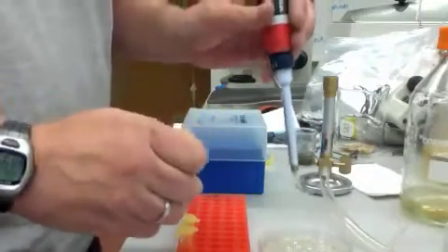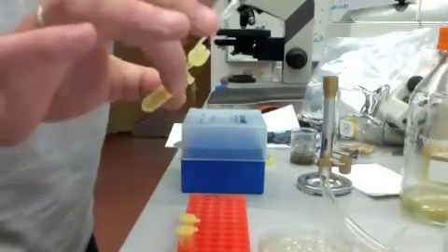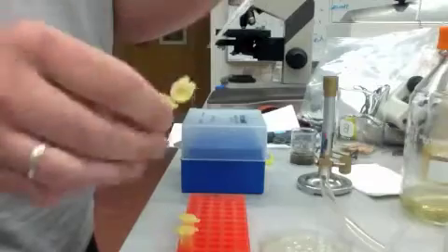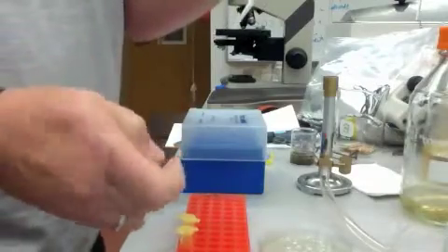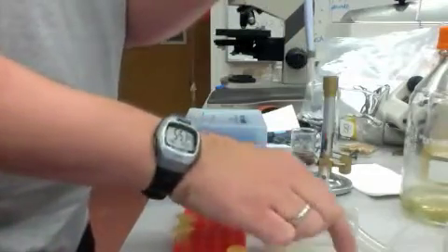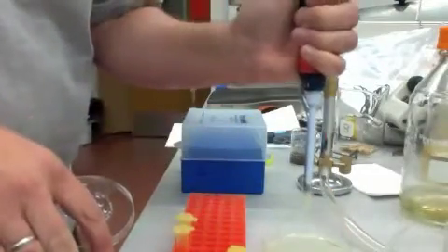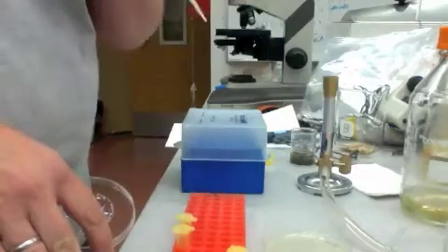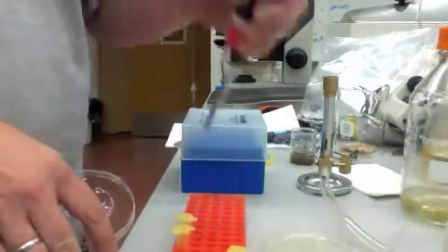I have my plate labeled as 1 to 10 and what my sample is. In this case, sample 1. I take out my 100 microliters from here. I set this usually in a different location so I remember what I've done. And I just take this and put this directly in the center, 100 microliters into the center of that plate. Get rid of my tip.